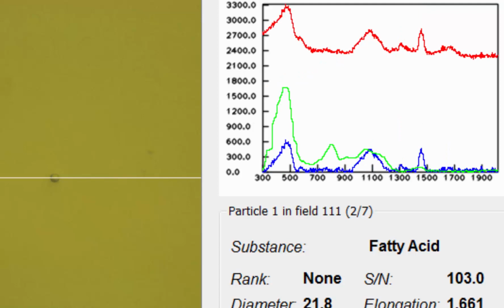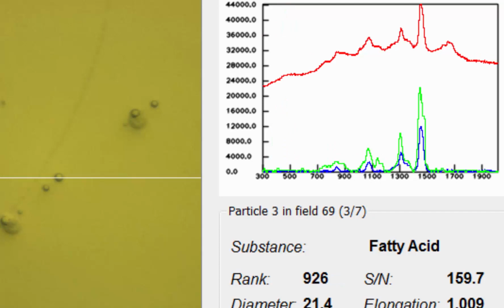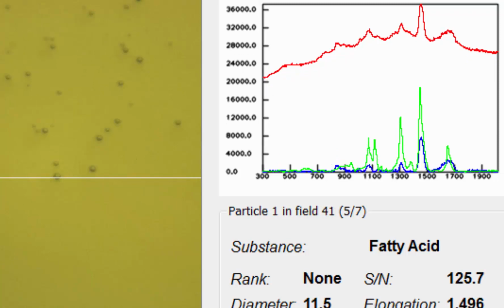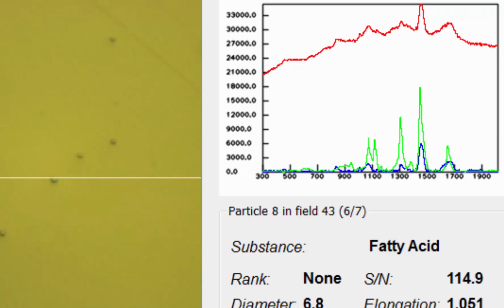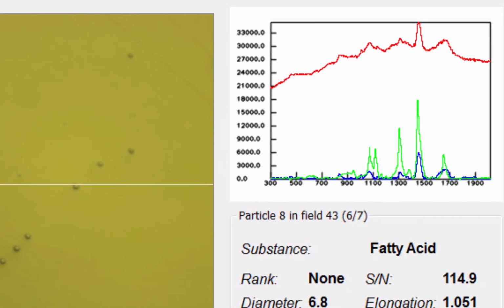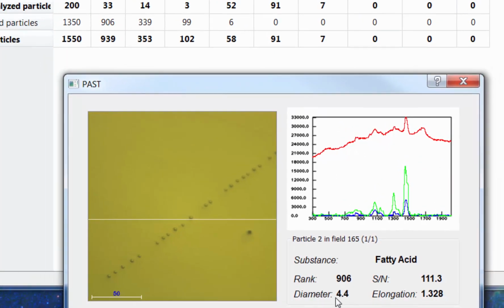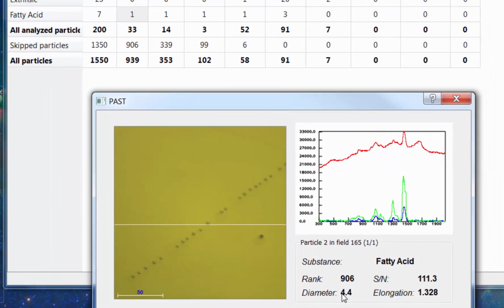That's a single one that has a diameter of 21.8. We have one here with 21.4, some with 15, some with 11, 6. With that demonstration, we can show you that down to a very small particle size of 4 micrometers, we can reliably identify fatty acids in a highly concentrated protein-based formulation.